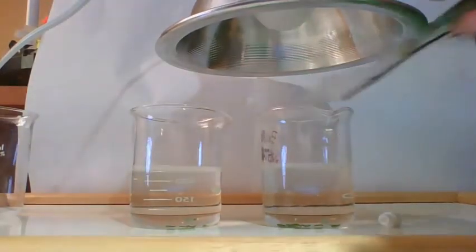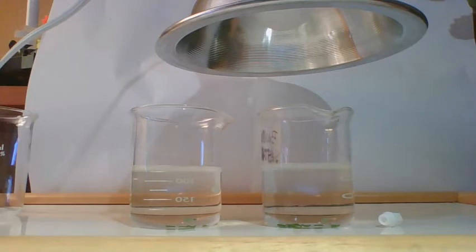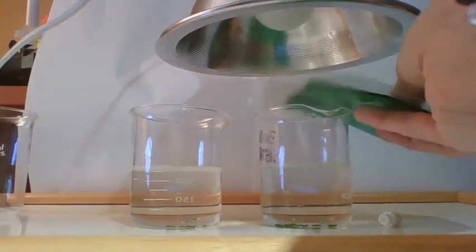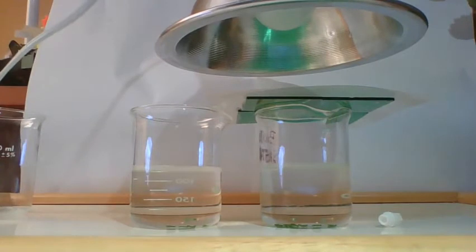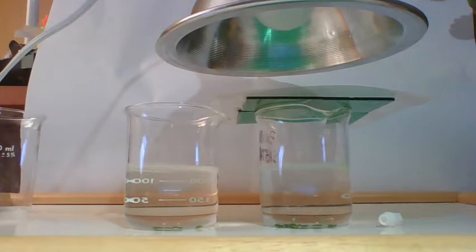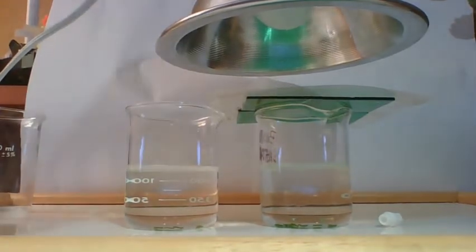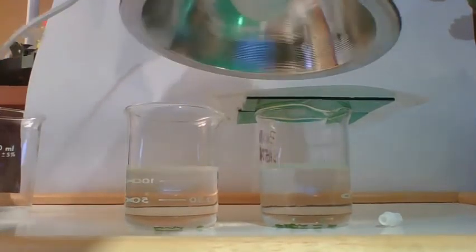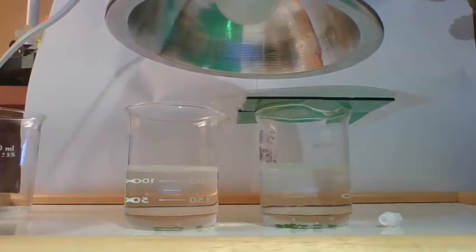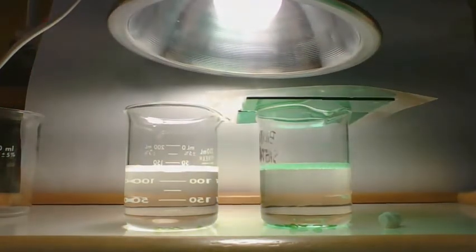Okay, real quick, I gotta trim this a touch. It's too big. Okay, here we go. Green filter's a little bit more manageable now. As soon as I turn the light on, you're going to find out that photosynthesis is faster than you thought it was, but you're going to look to see which one does photosynthesis faster: green filtered light, where they only get the green, or white light, where they get all the colors of light. All right, stopwatch is on.